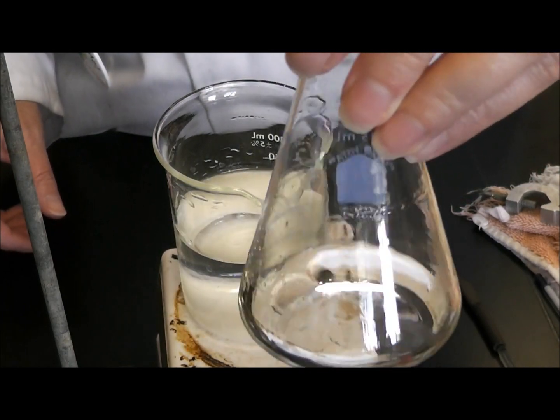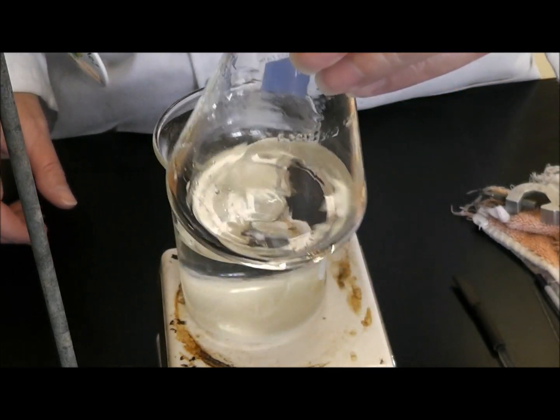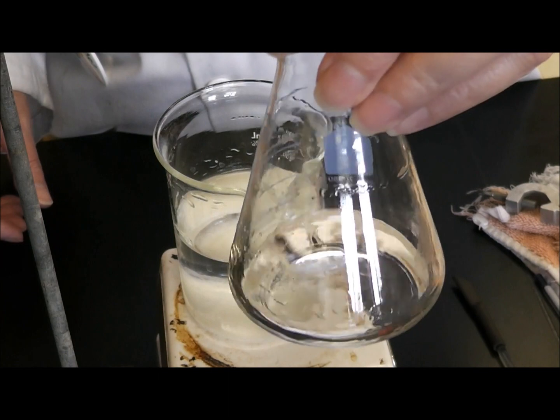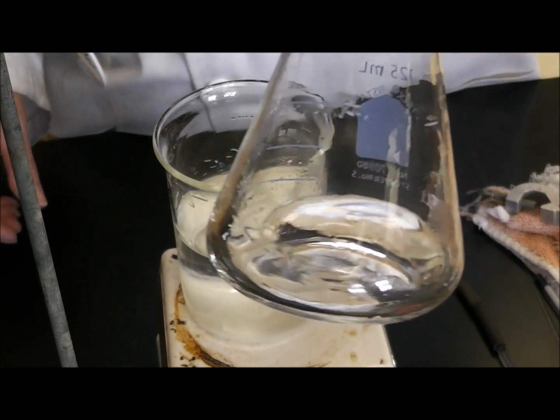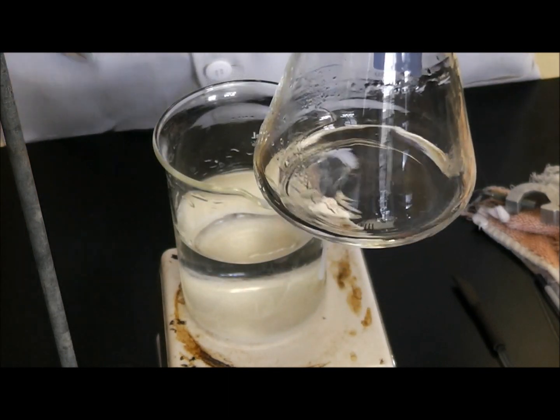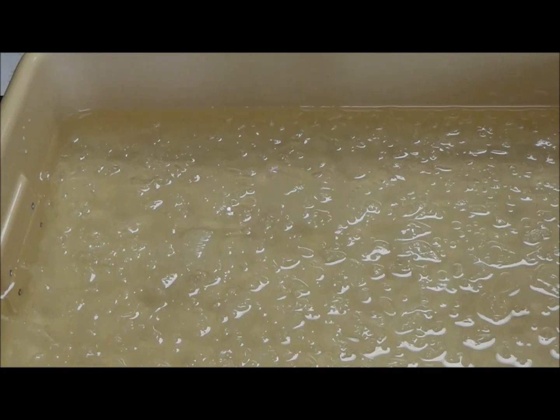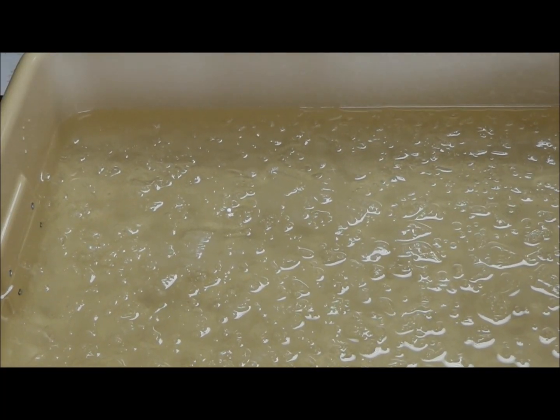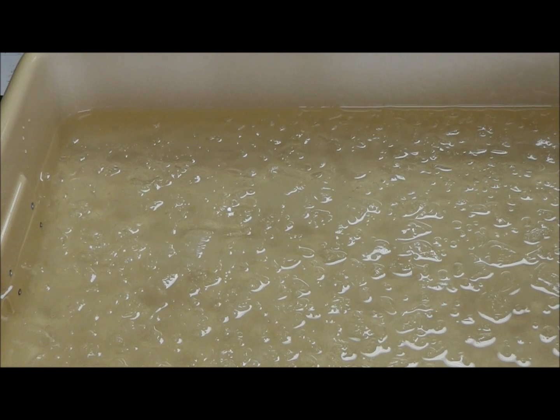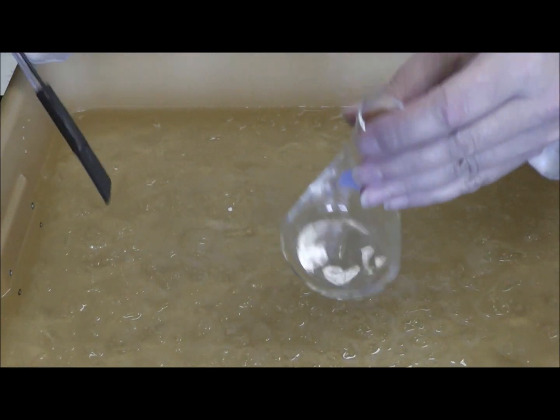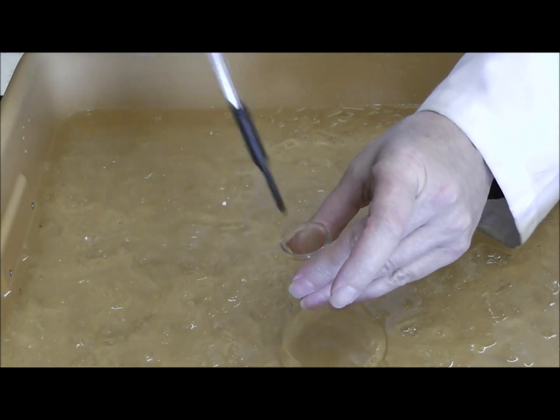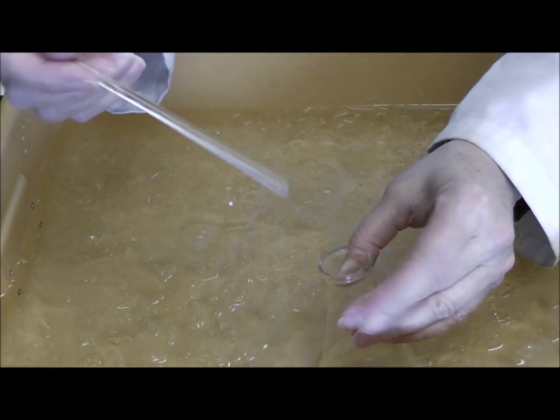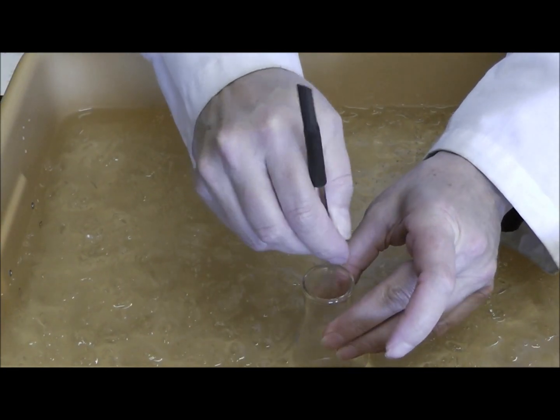So what I'm going to do now is I am going to go over to the ice bath, and I am going to form crystals. Okay, so I am going to put my aspirin into the ice bath, and with my, I think I'll use my glass end of my rubber policeman.